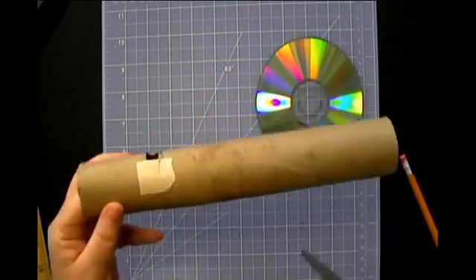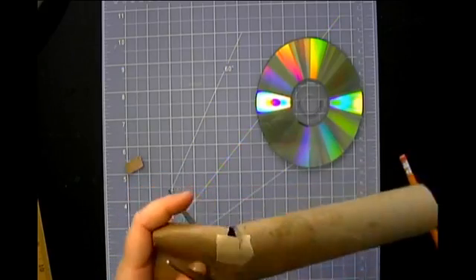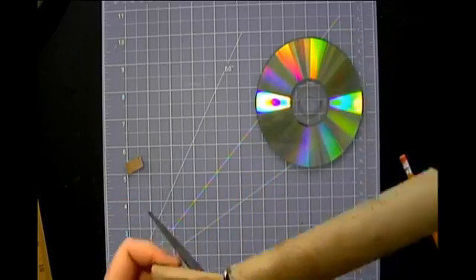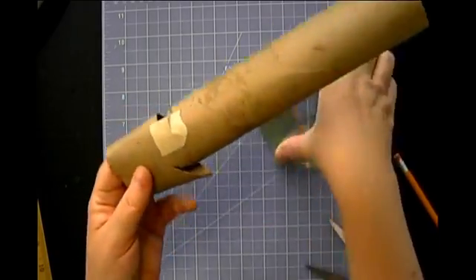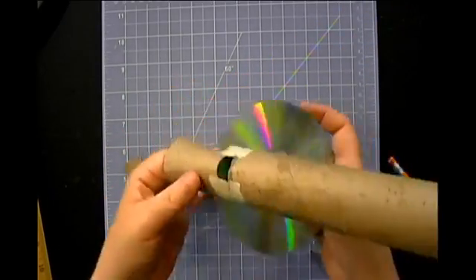I am actually going to go ahead and cut mine just a bit deeper. We only go halfway at first because it's easier to make this slit a little bit longer. It's very tough to make it shorter, okay? So there we go. I'm just going to make that just a hair longer, maybe a quarter of an inch longer. All right, and then I'm going to fit my CD in there.